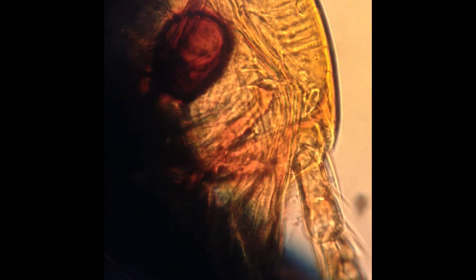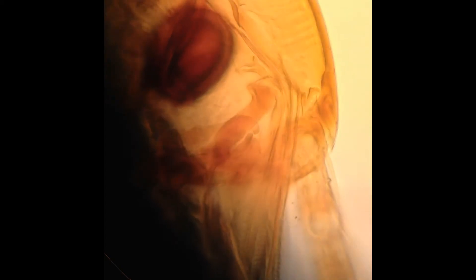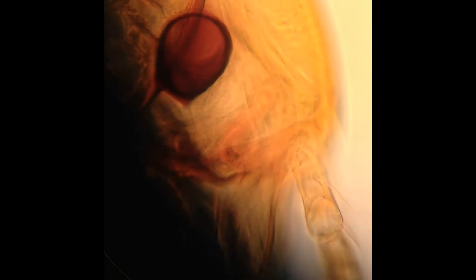I'm going to adjust the condenser, the aperture, see the depth of field more, opening it up again. Let's see if I can refocus — fine adjustment. Let's look around. That's the jumping leg. Let me refocus. See how the fine focus adjusts through the different layers and depths. I'm going to adjust the condenser so we can see it all at once.